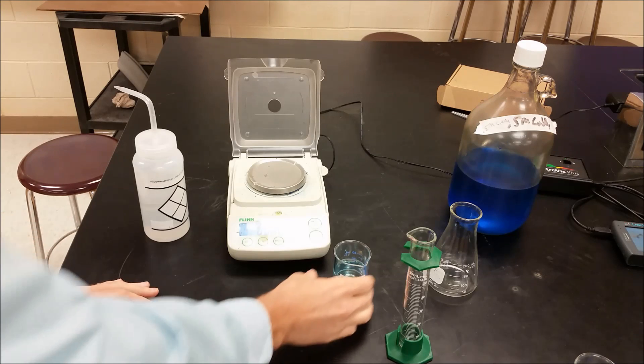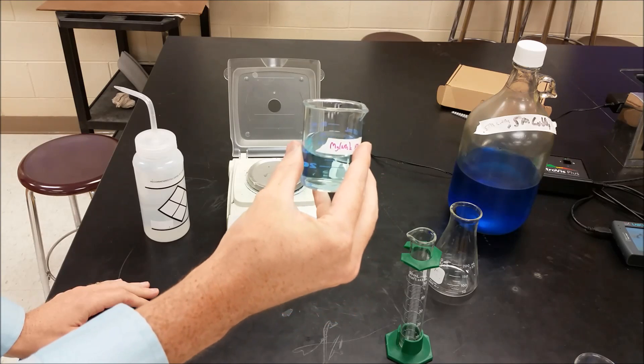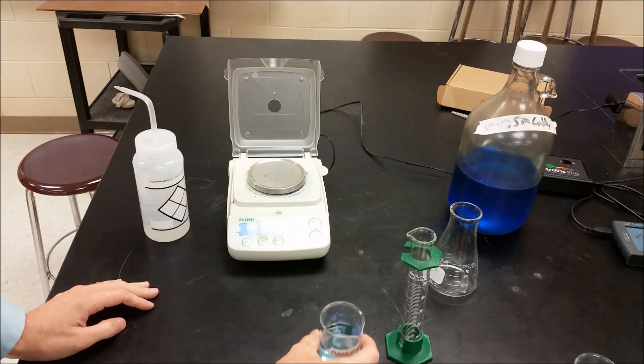Okay, so our experiment here, we have an unknown concentration of copper(II) sulfate. So we're going to try and measure this in two different ways.